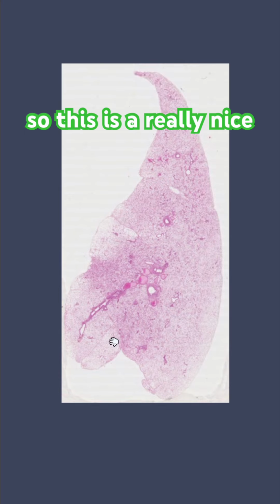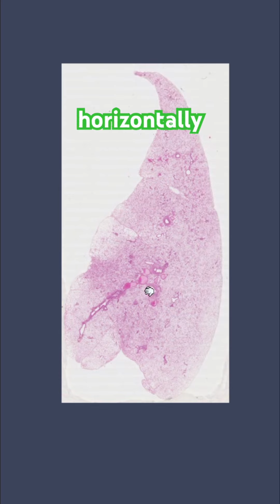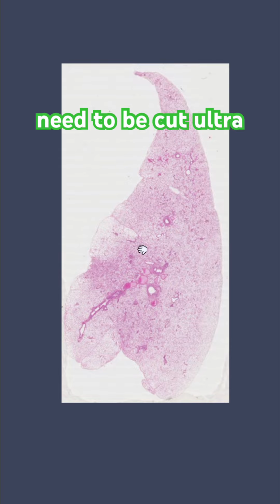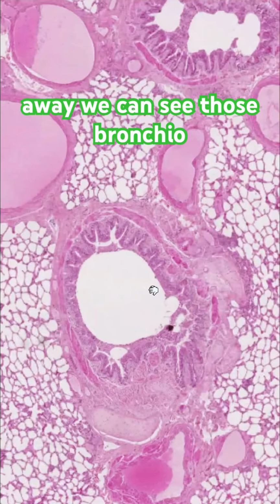So this is a really nice example of sectioning. So this has been sectioned transversely, horizontally across the lung. And we can draw attention to the fact that specimens need to be cut ultra thin, 1 cell thick. Zooming in straight away, we can see those bronchioles.